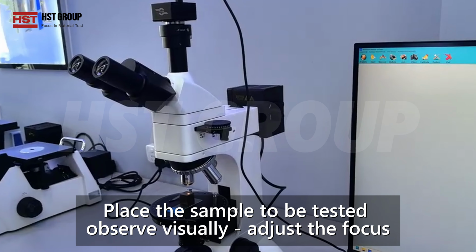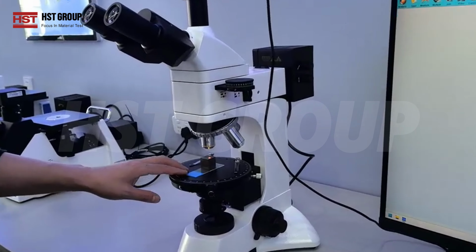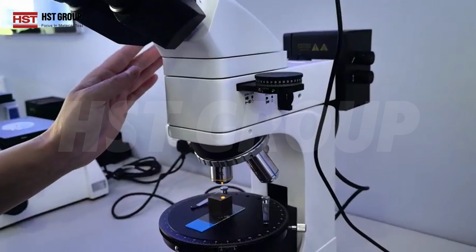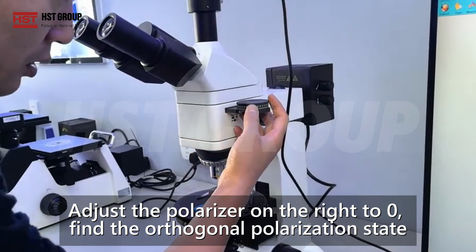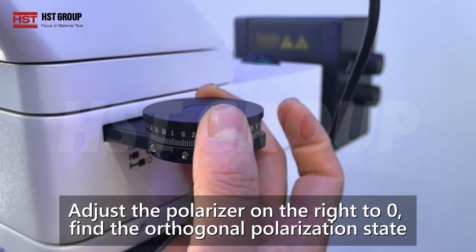Place the sample to be tested. Observe, visually adjust the focus. Adjust the polarizer on the right to 0, find the orthogonal polarization state.